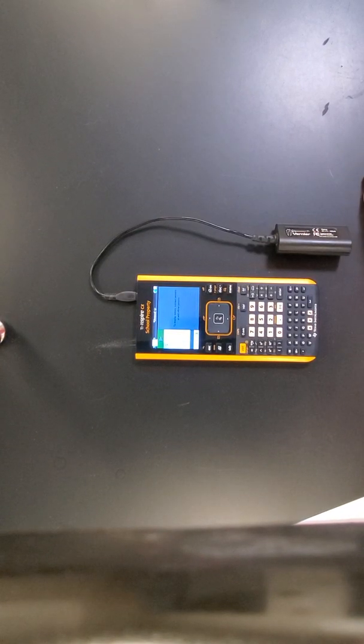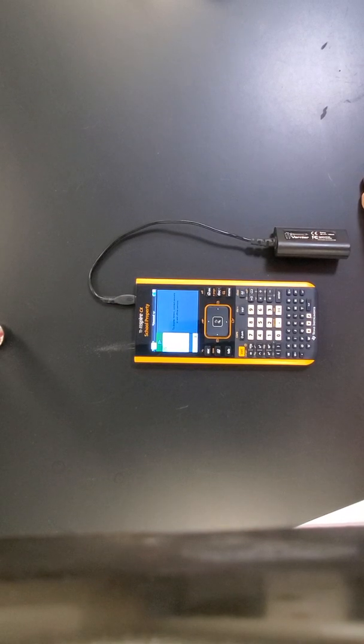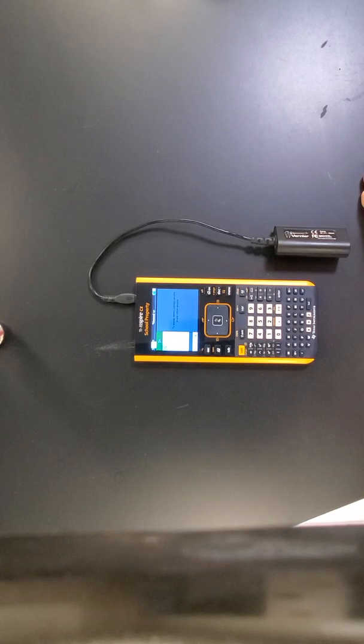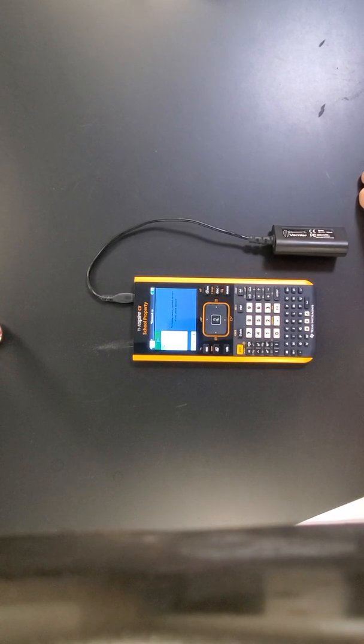Okay, make sure that you let them dry. So either get a paper towel and try to dry them, or leave them facing down so that the water runs down. Make sure that you place all the chemicals and equipment back, and make sure that you always clean your table and wash your hands, put all the equipment back, and then go ahead and go on to your post lab.